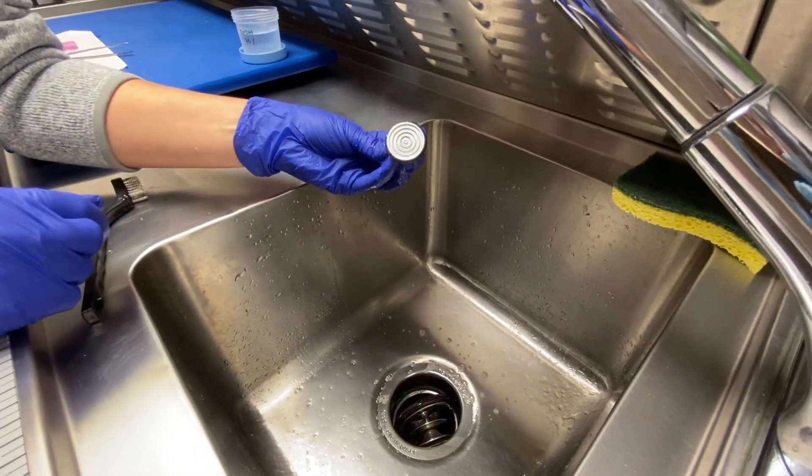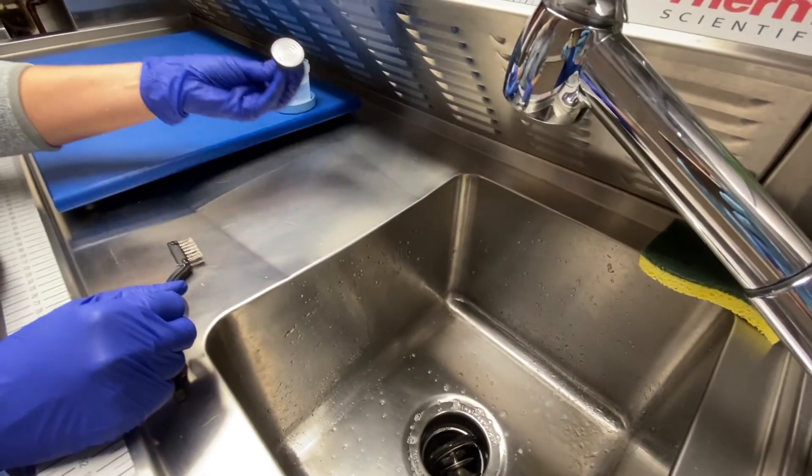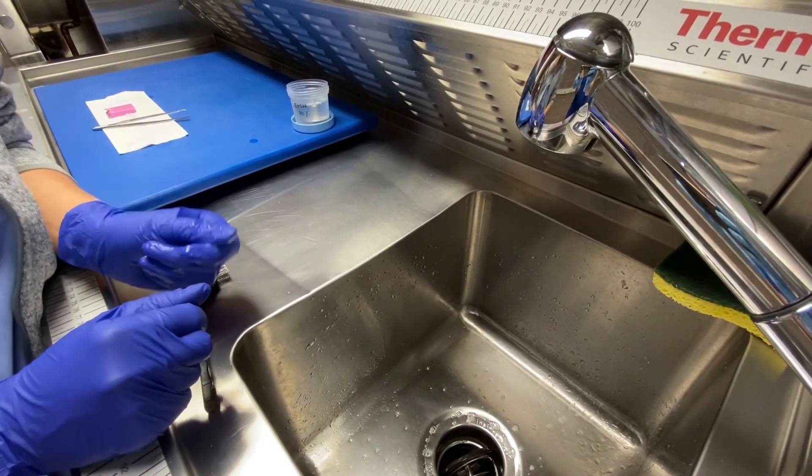After all the OCT has been removed, place your chuck directly in ethanol for several minutes.